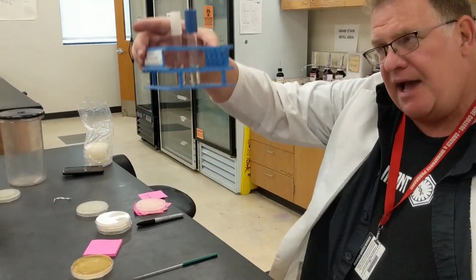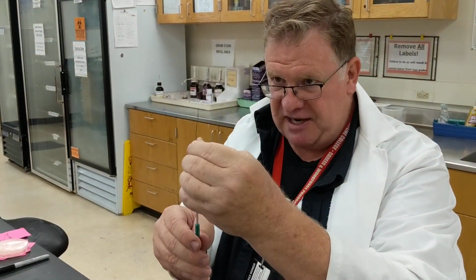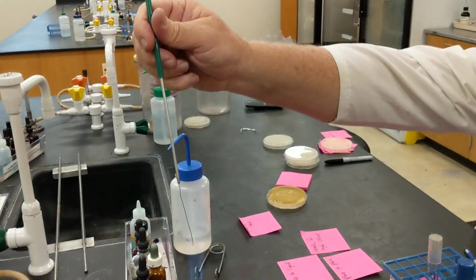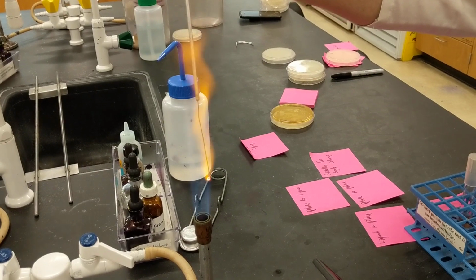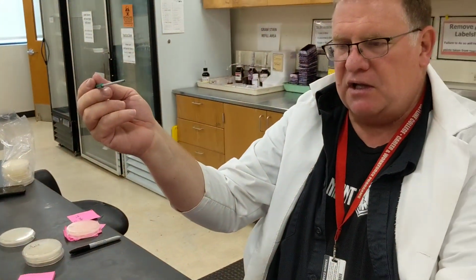So what we want to do first is go from a liquid culture to a liquid culture. I already have my flame going pretty high. I'm going to use these tubes as a demo. What you want to do is make sure that your needle is as straight as possible, and make sure that it is not red hot when you're doing this. You're going to get your needle red hot first. I got this flame set up and I got my needle red hot, and I'm just going relatively slowly.